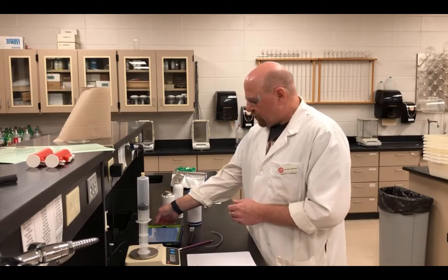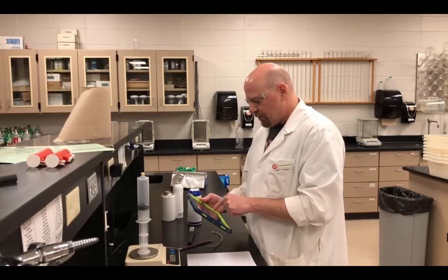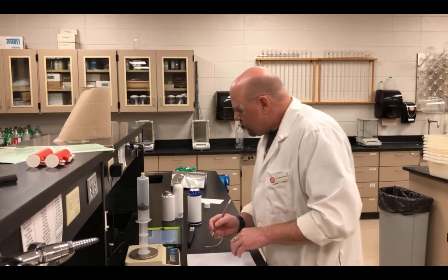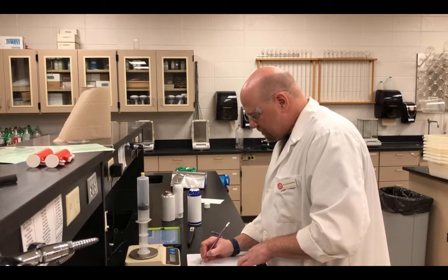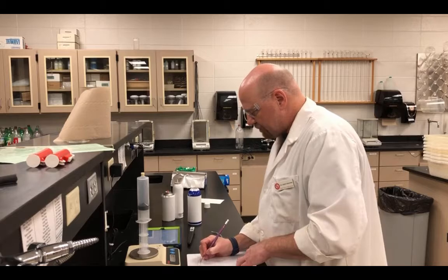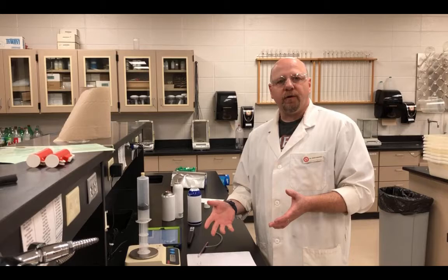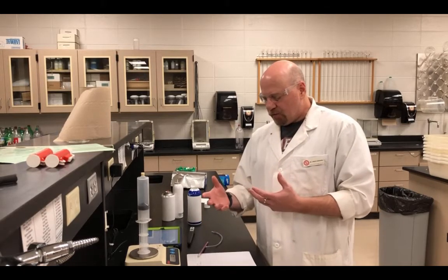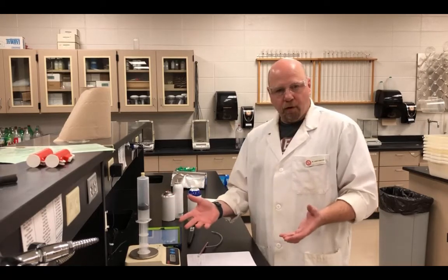And we also need to determine what the barometric pressure is. I have a barometer app on the iPad for this. It reads 0.9759 atmospheres. Now, this is enough information for us to determine what the molar mass of the gas is going to be. Now I'm going to do 2 more trials and I'll record those.